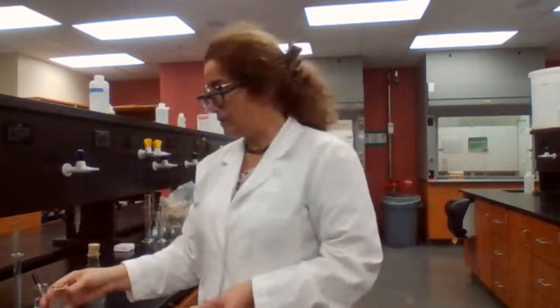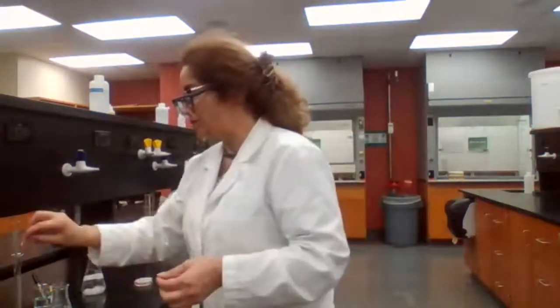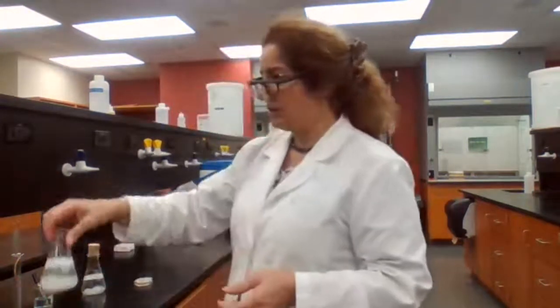So the crystallization is going to be complete. Any response? What should be my next step to make sure the crystallization is complete?